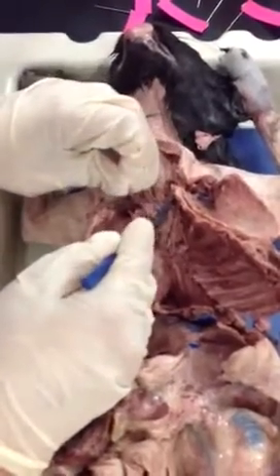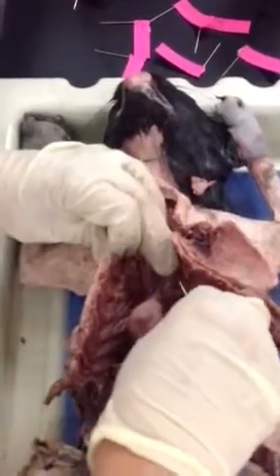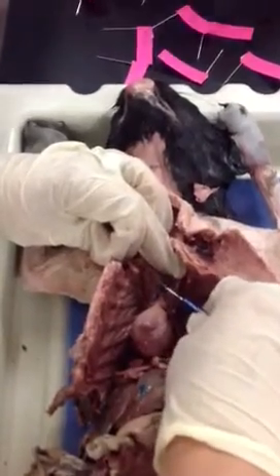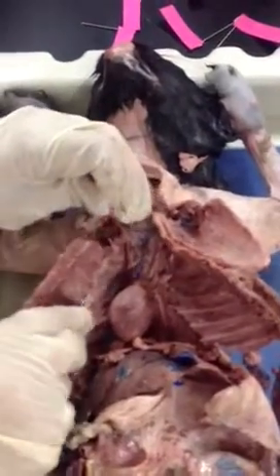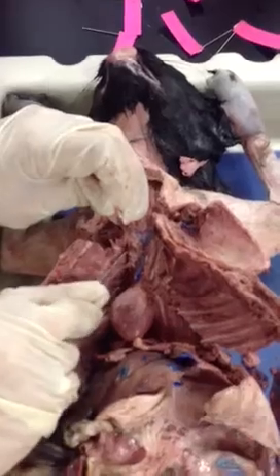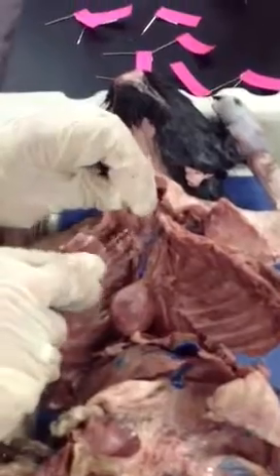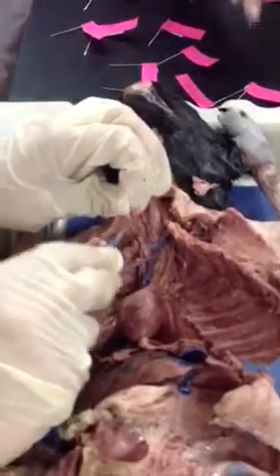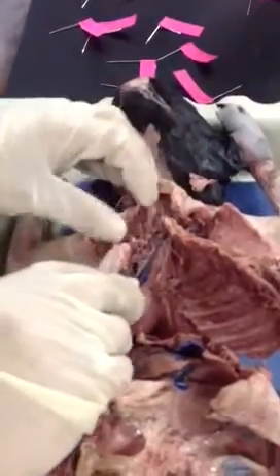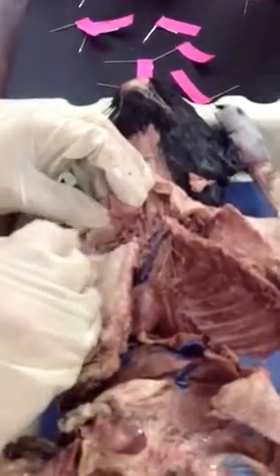What happened with the branch? Okay. The first branch that we're going to see here from this subclavian is going to be our internal mammary. You see it here? You see the small caliber vessel? My internal mammary. Then it's going to give me the vertebral. The vertebral, you see it here. And then it's going to give me the costocervical, and this one got severed. It's not uncommon.